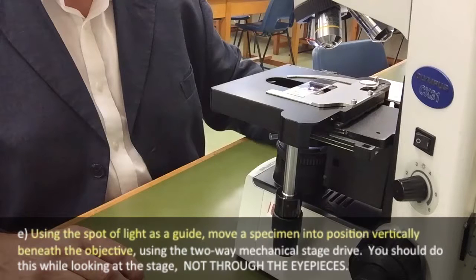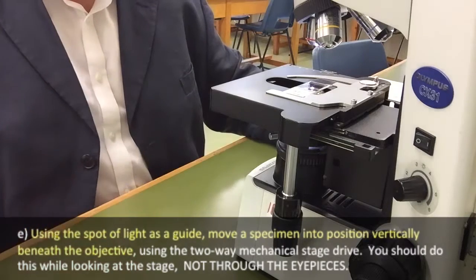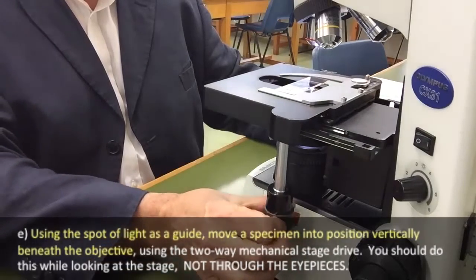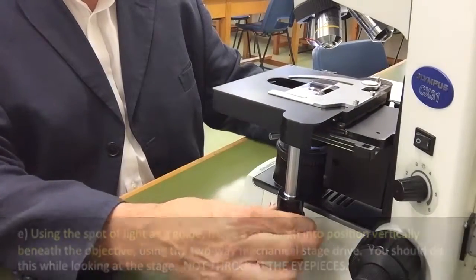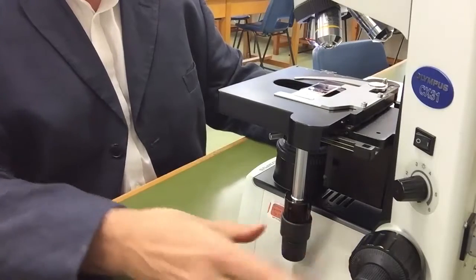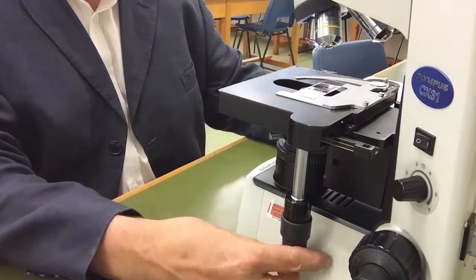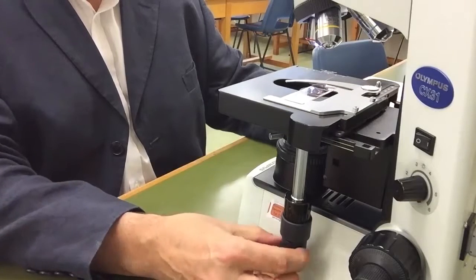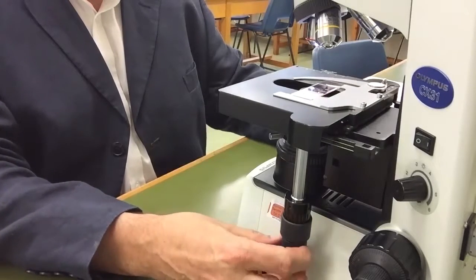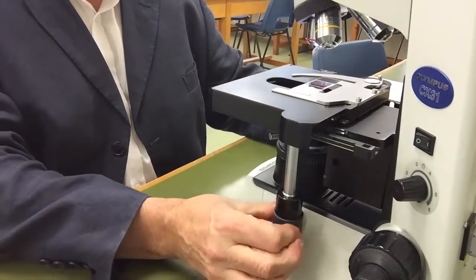Using the spot of light as a guide, position the specimen directly below the objective. This is done using the movement controls for the stage, which can move the stage towards you and away from you and also left and right. Position the specimen — which you'll see is stained pink — so it's directly above the spot of light coming through the condenser.